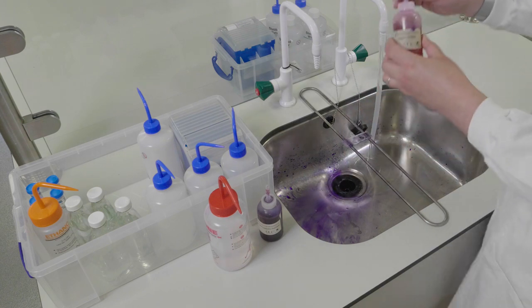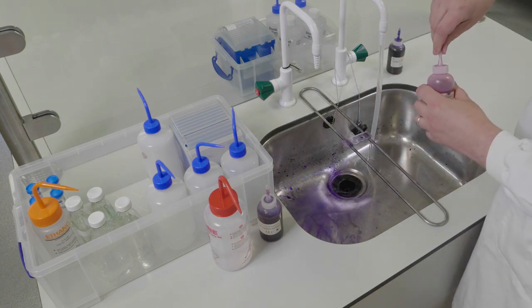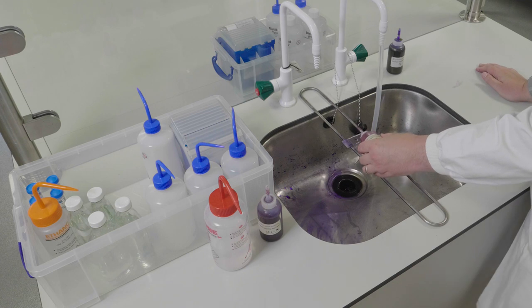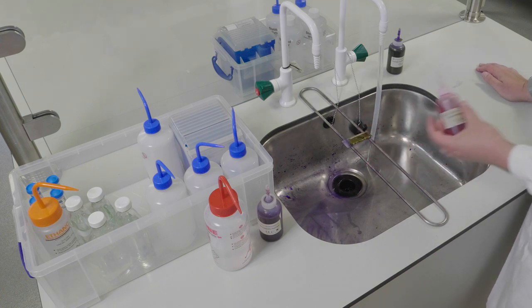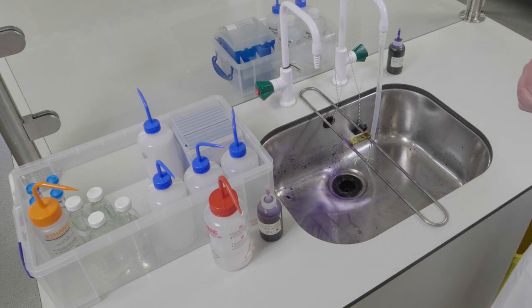Next, flood the slide with Lugol's iodine. You should then wait another 30 to 60 seconds before washing it off the slide.